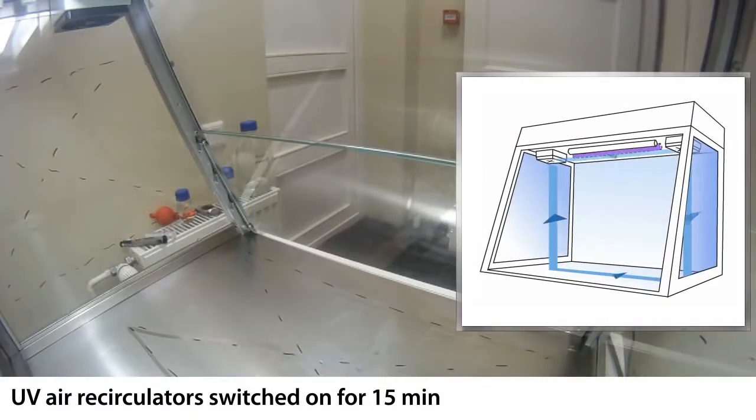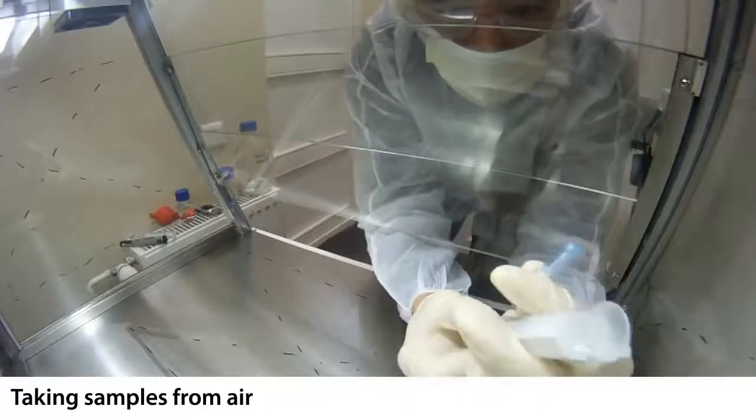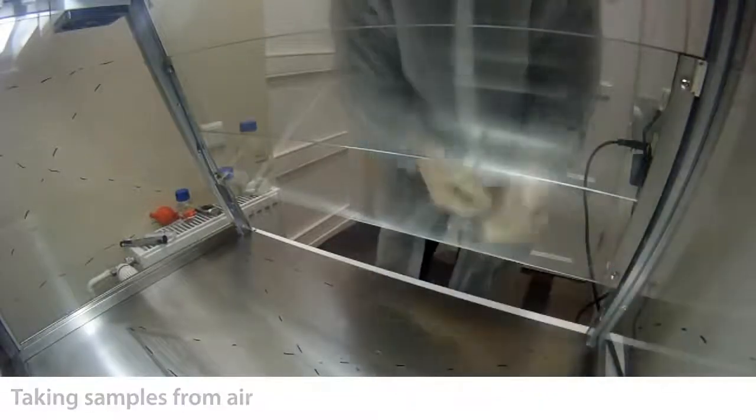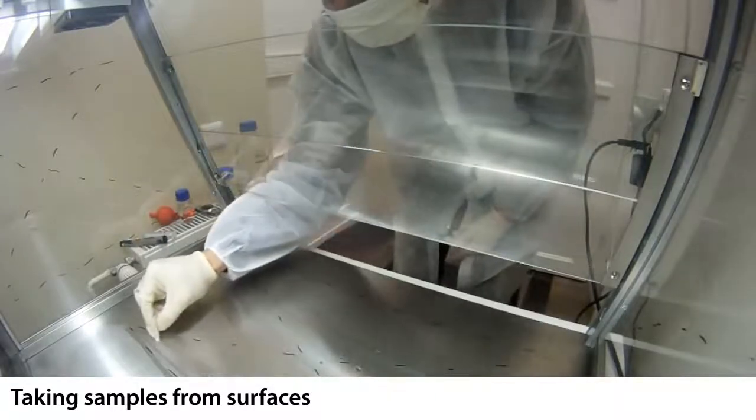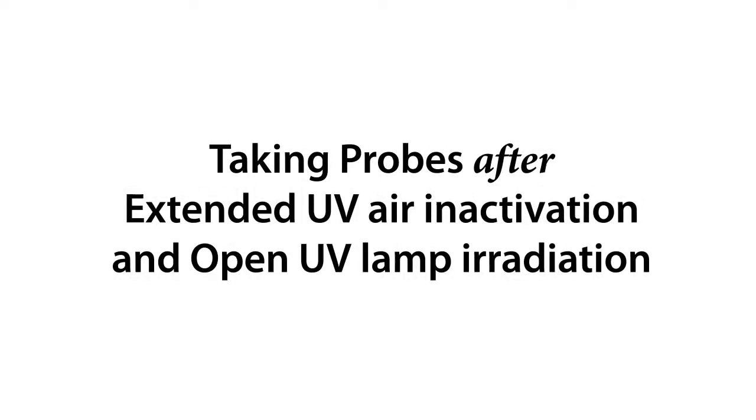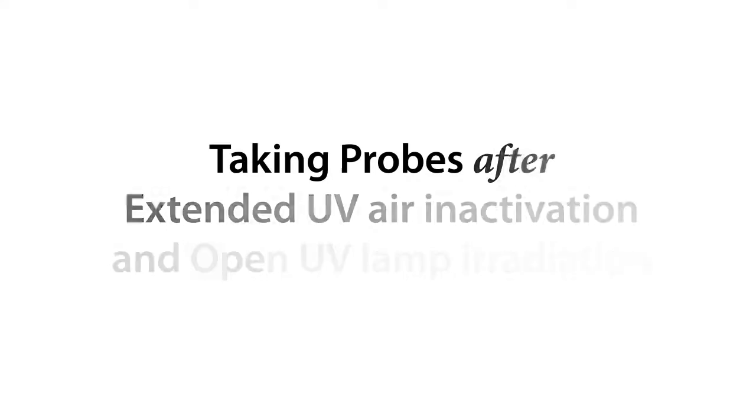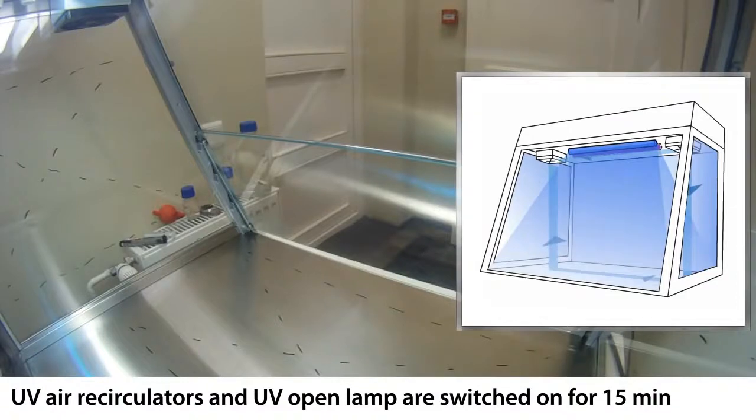Now we are going to take samples after UV air circulation. We will be taking samples after UV air circulation combined with open UV lamp irradiation.